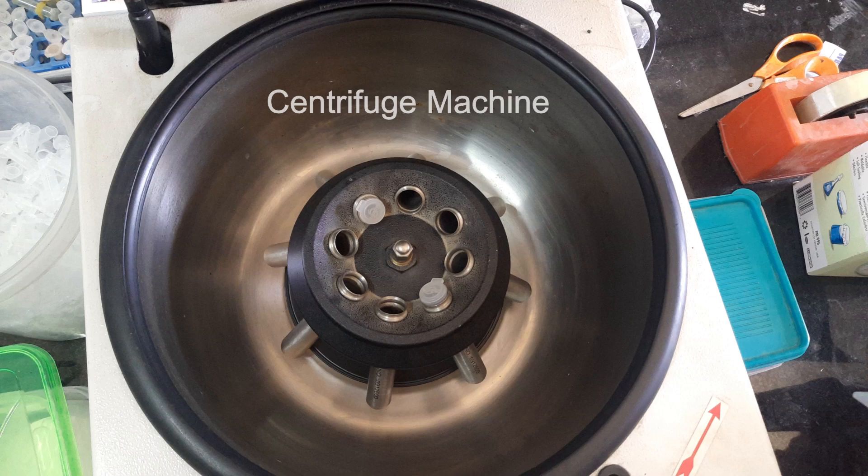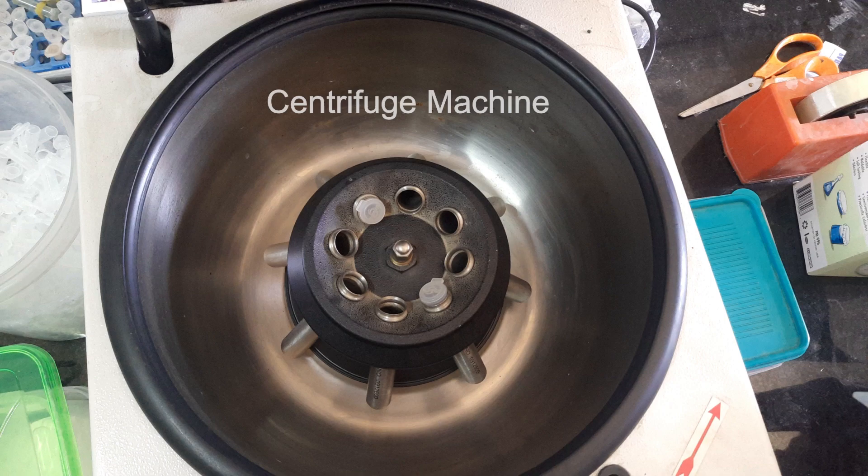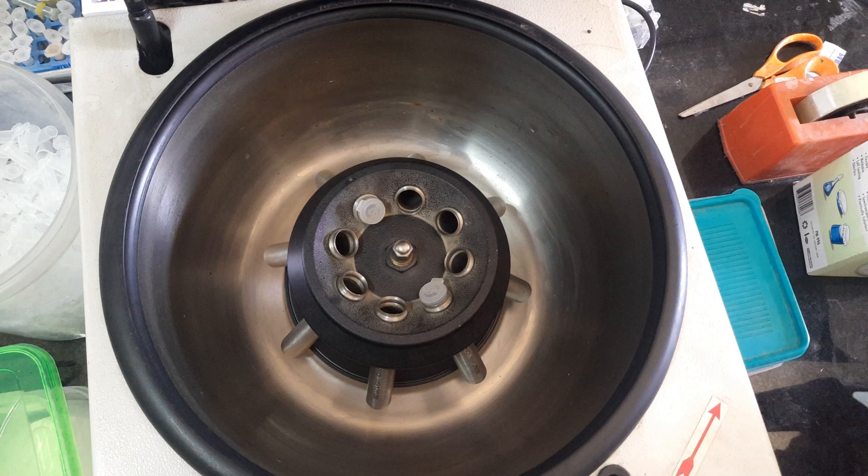After the reaction is finished, we need to separate the nanocrystals from the solvent. To do that, we use a very simple principle called centrifugation. Here, we rotate the entire solution to such a high revolution per minute that the particles — namely the nanoparticles or cesium lead bromide — get detached from the solution and get precipitated. This is how it looks.